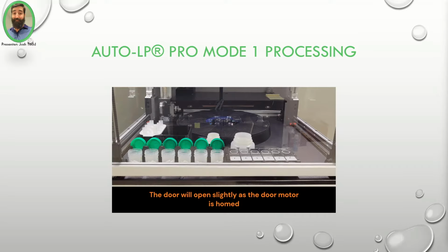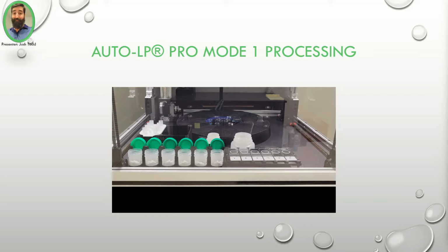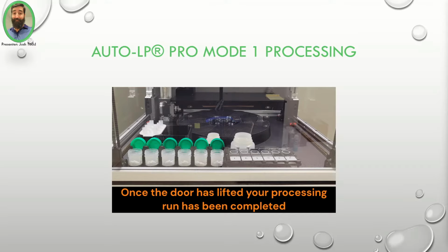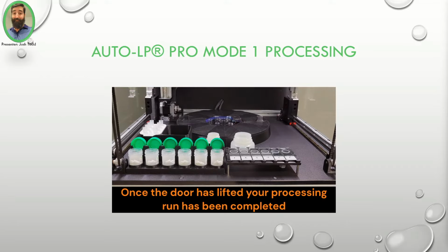The door will open slightly as the door motor is homed, waiting for the complete door open for your processing run to be completed. Once the door is lifted, your processing run has been completed.